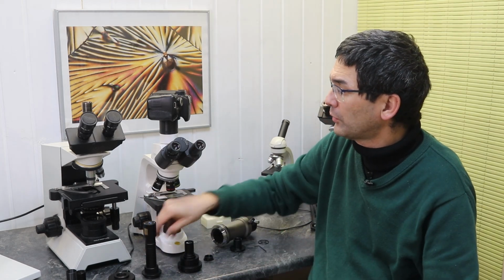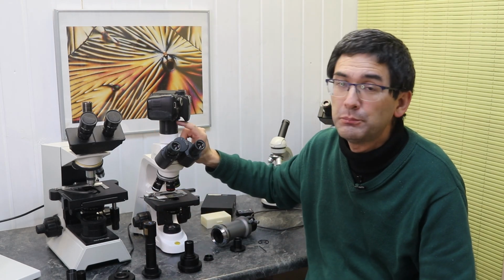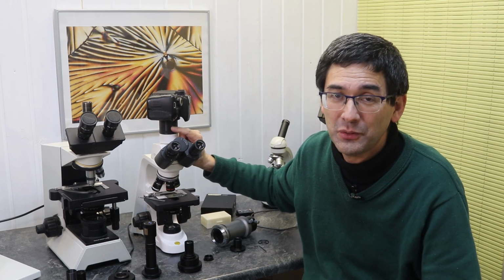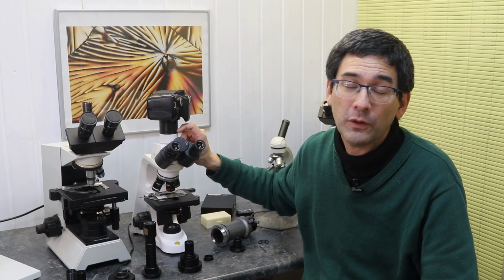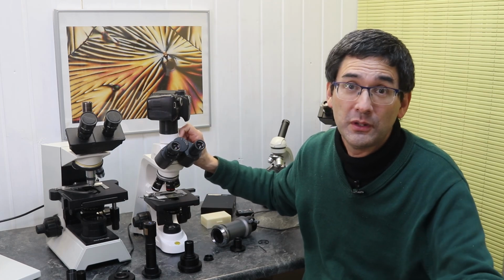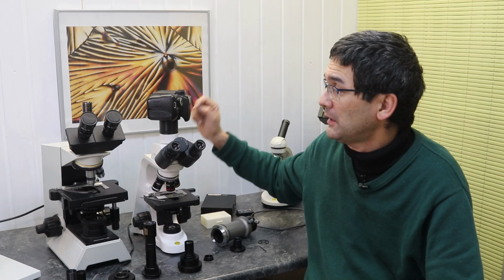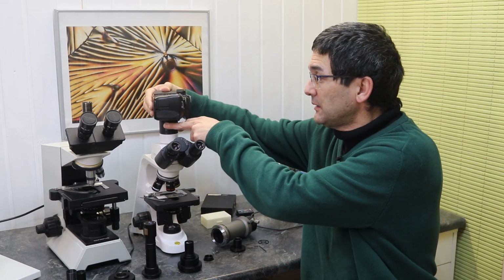And I'm now going to show you a little bit of how I have 3D printed this. But if you have a CNC machine somewhere, you can make that out of aluminum. Or maybe you can use heavy duty cardboard and do something like that as well. And that's basically it.